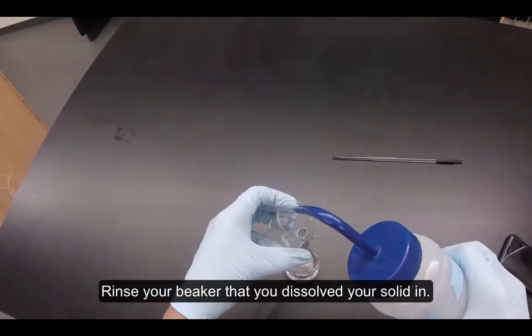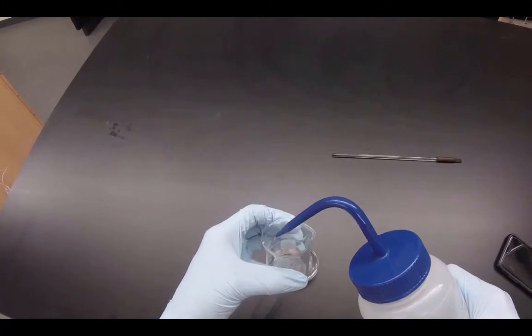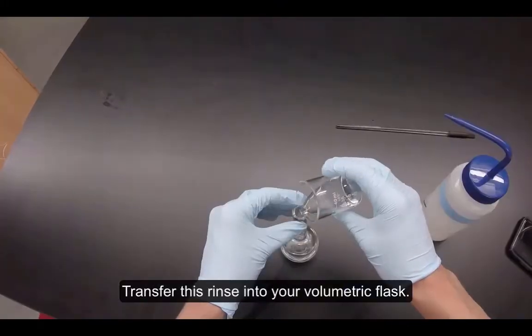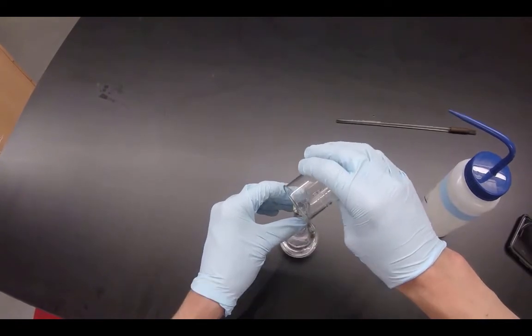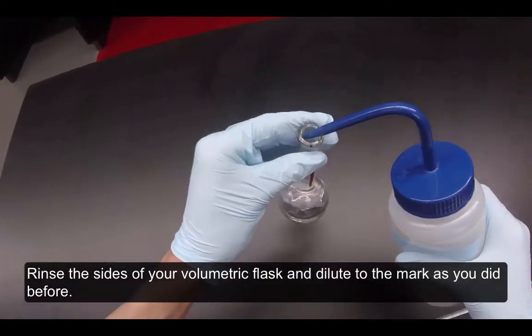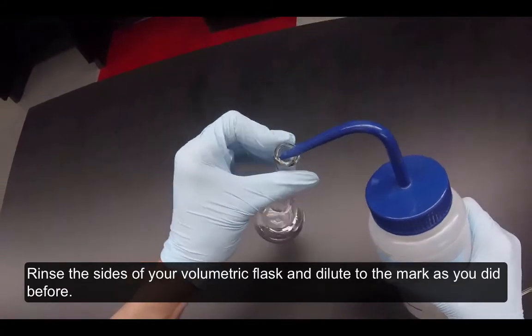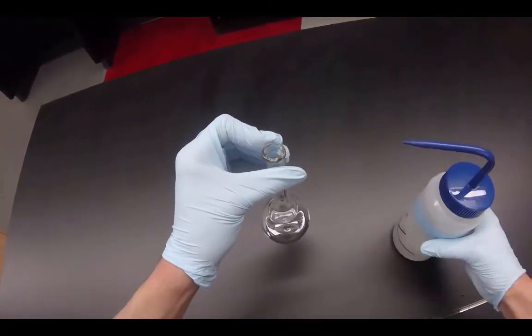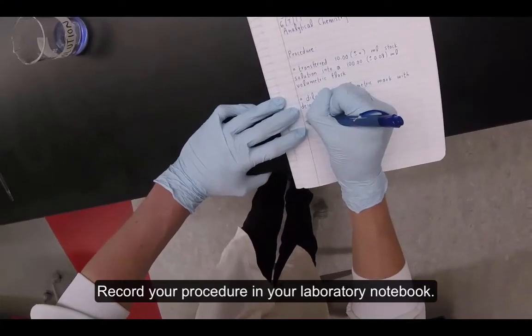Rinse your beaker that you dissolved your solid in. Transfer this rinse into your volumetric flask. Rinse the sides of your volumetric flask and dilute to the mark as you did before. Record your procedure in your laboratory notebook.